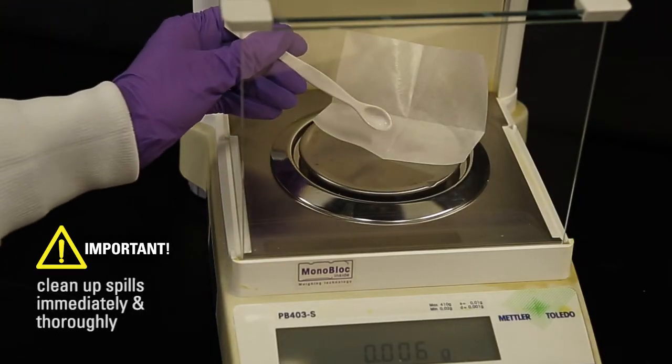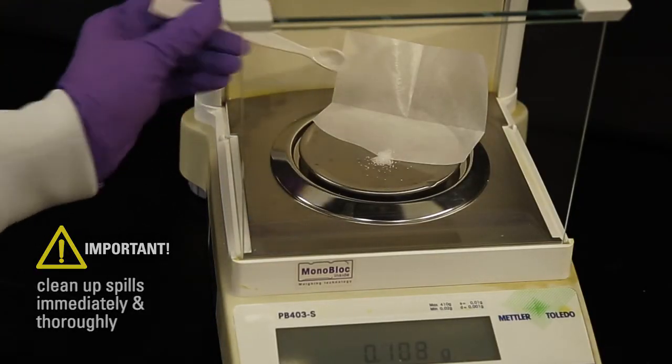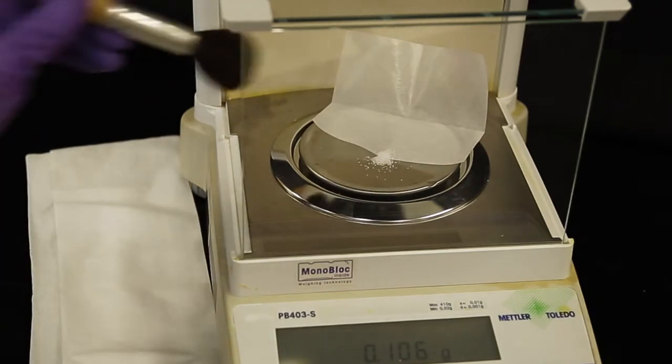If you happen to spill the chemical, clean the balance immediately and thoroughly with a soft brush.